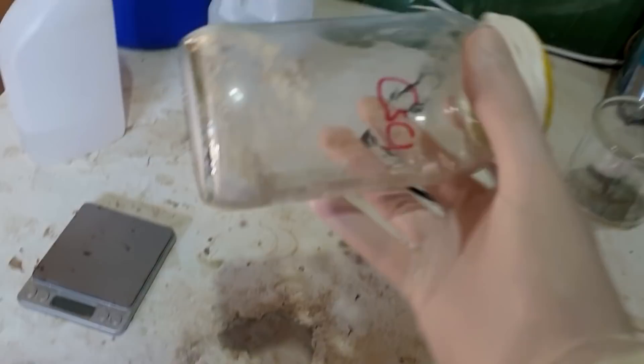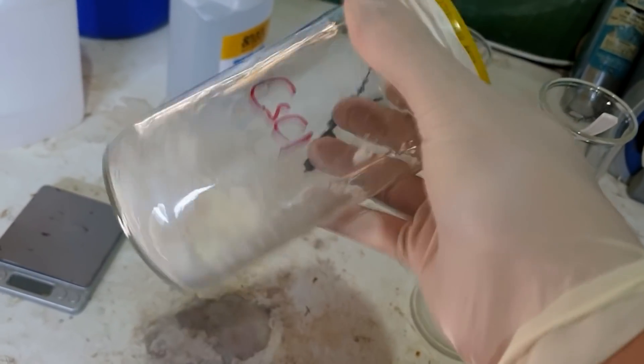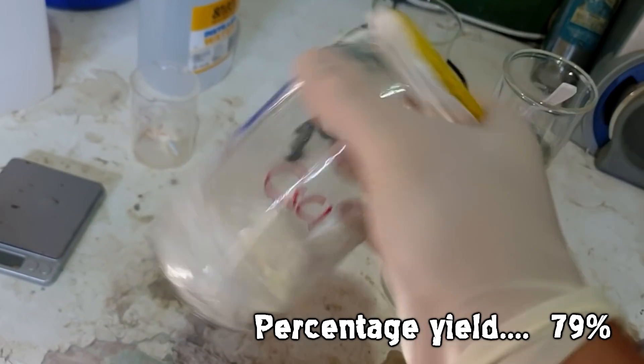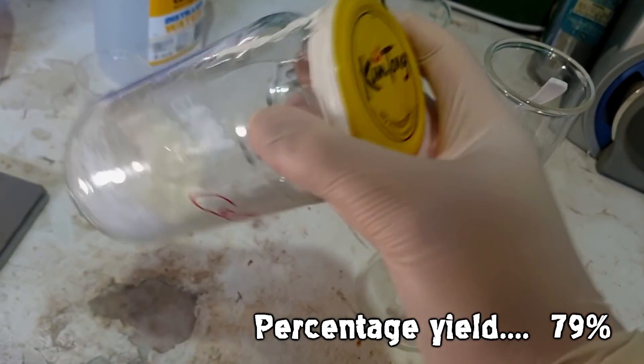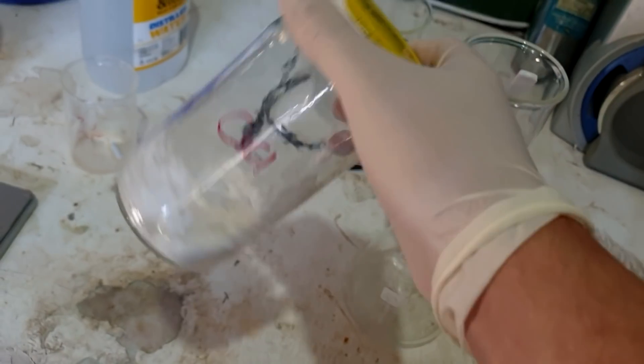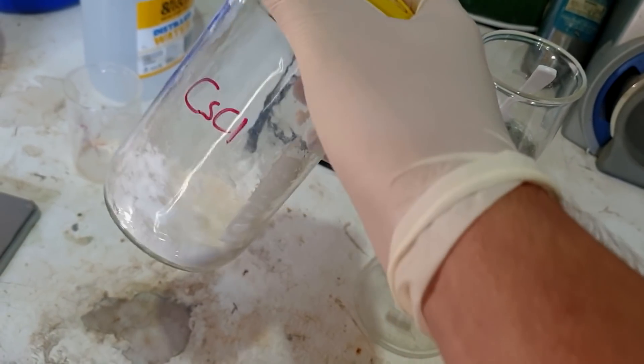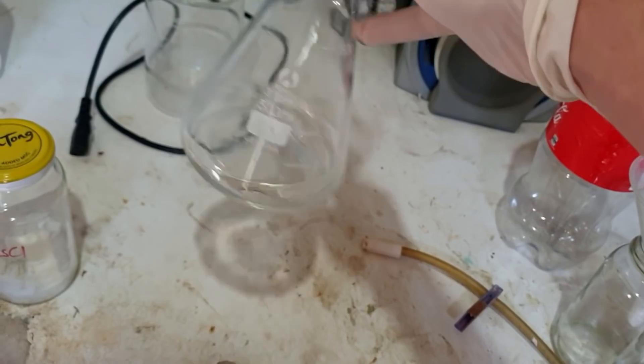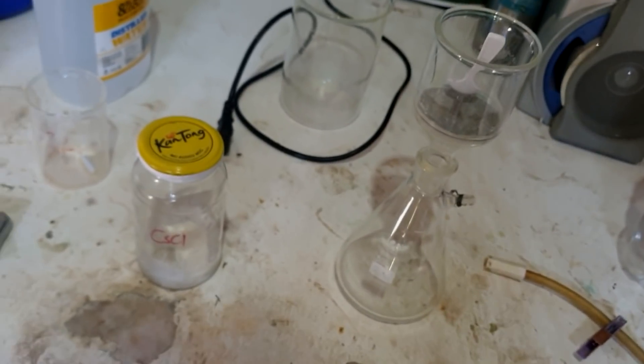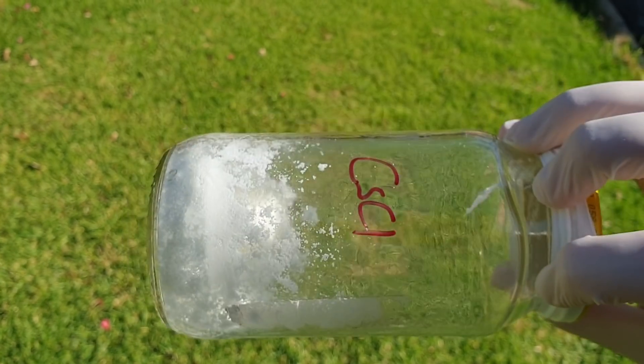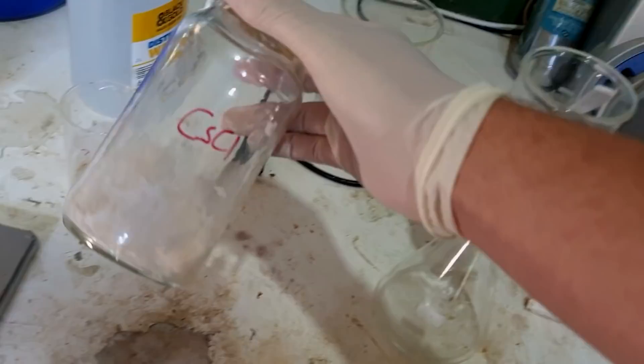Here's our final product. It's looking mostly dry, it's looking pretty good. It is disappointing we only got 32.5 grams. Our maximum yield is actually 41.4 grams, so it doesn't give us a great yield. There should be no reason we shouldn't get basically 100%. The reason is when I suspended it in that acetone, there was still a little bit of water left, which carried quite a bit of cesium chloride. When you're dealing with a substance that has a solubility of nearly 200 grams per 100 mls, it's ridiculous. A couple of mils of water can carry quite a bit of cesium chloride away.